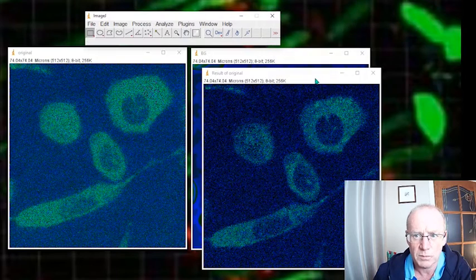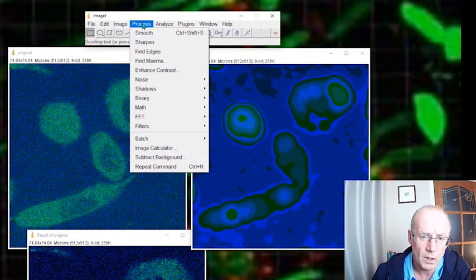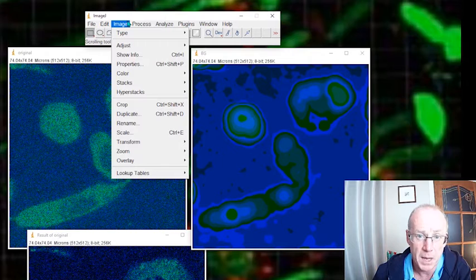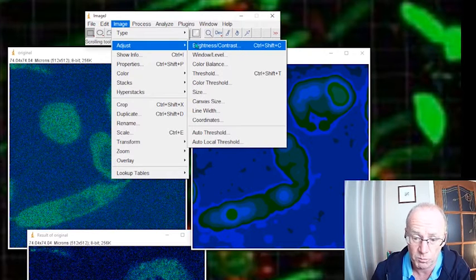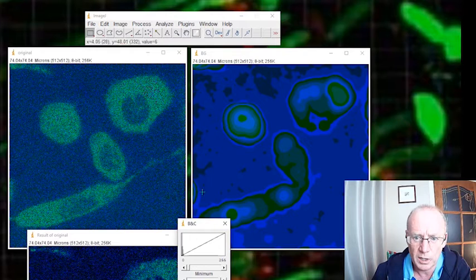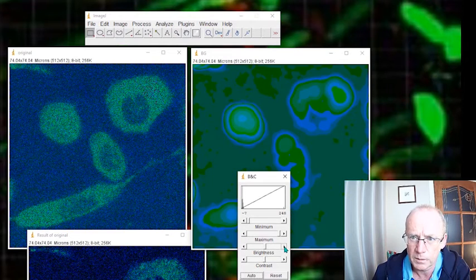Now, one of the advantages of having the background is that we could adjust it. I would only ever do this if you wanted to make a pretty image. You would have to be very careful of adjusting the background and then subtracting if you were going to measure the brightness from an image, because you have in effect adjusted the numbers. But let's go through the process anyway, and you can see what happens. I'm going to adjust the brightness and contrast in the background image. Take it up a little bit, maybe something like that. Kind of smooths out the holes that you see there. Apply that.